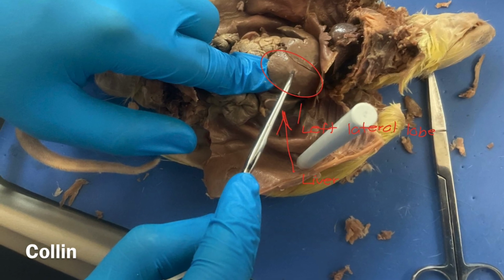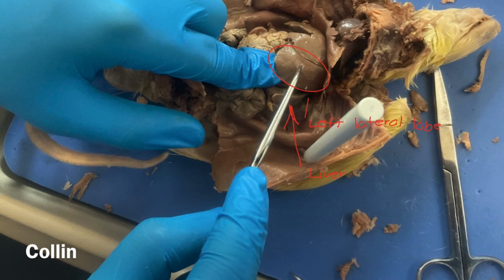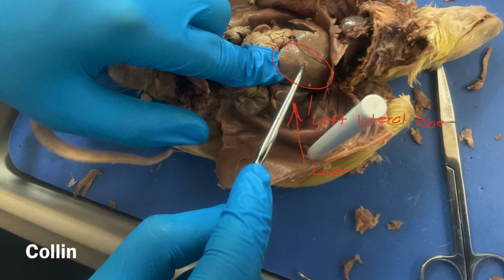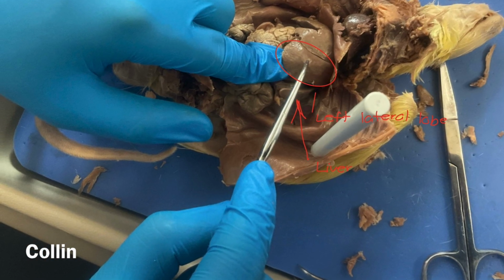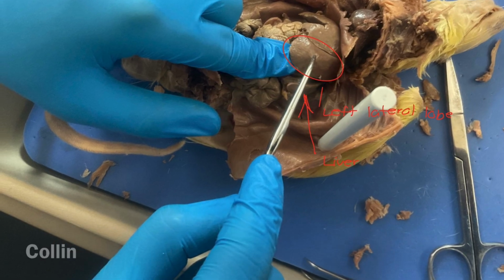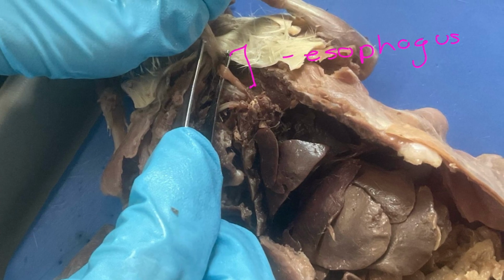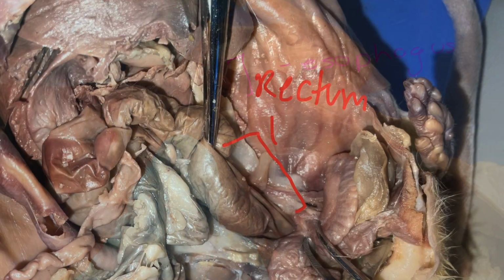The median lobe, which is the largest lobe, the left lateral lobe found on the left side of the abdominal cavity, the right lateral lobe located on the right side, and the caudate lobe, a smaller lobe positioned dorsally and is near the esophagus and the stomach.